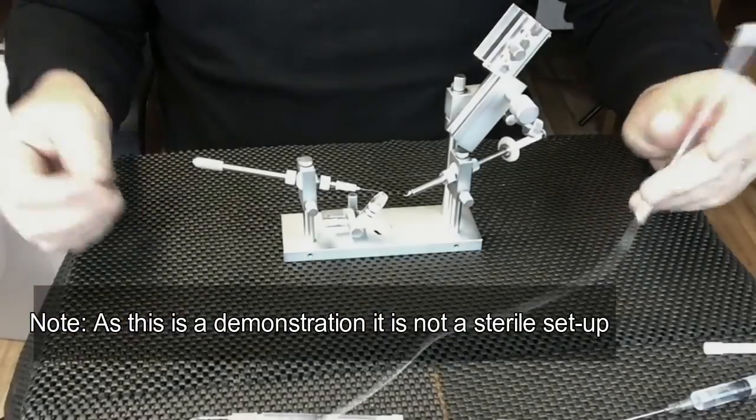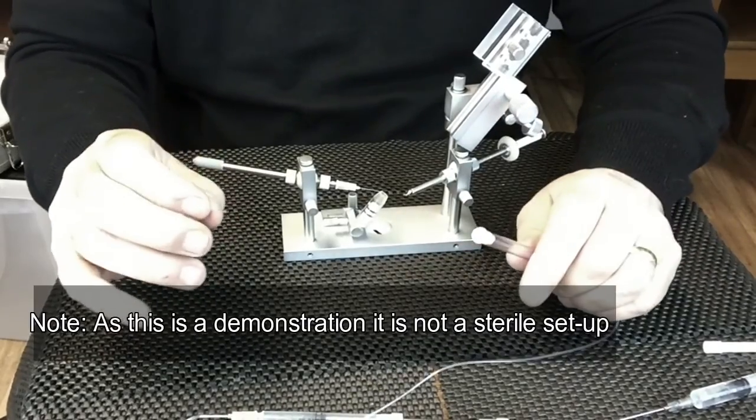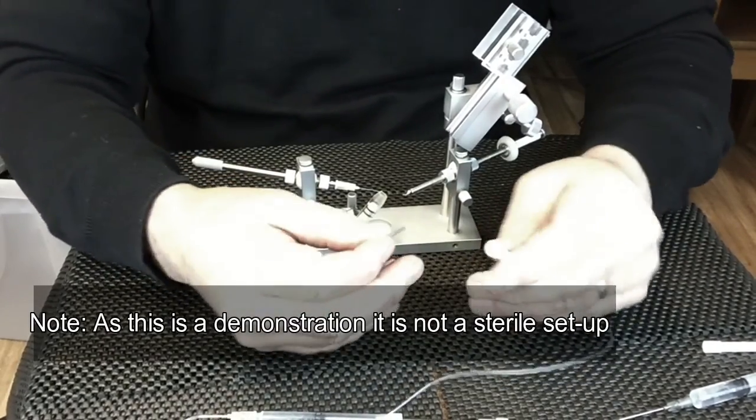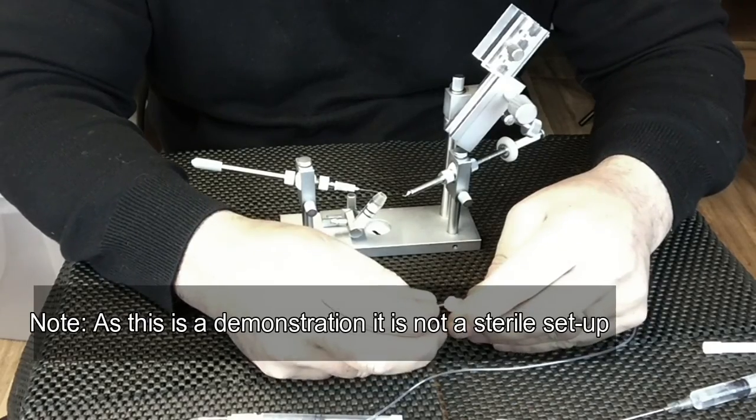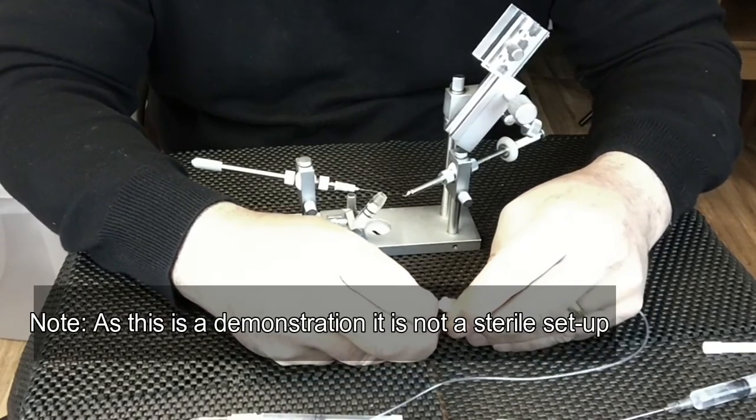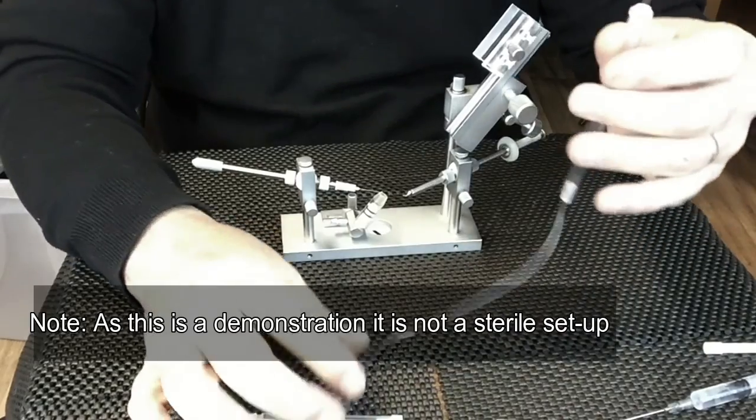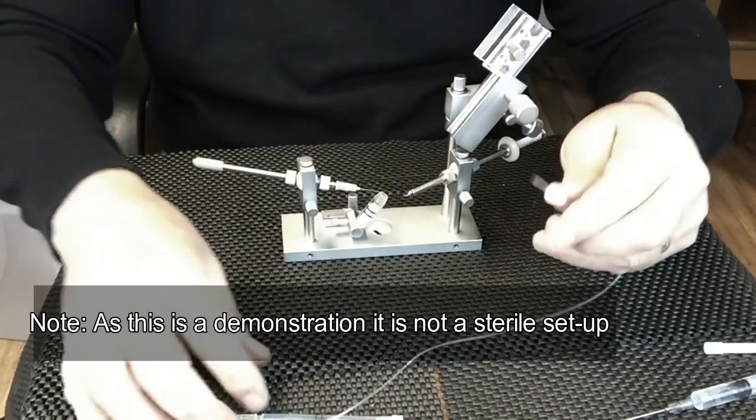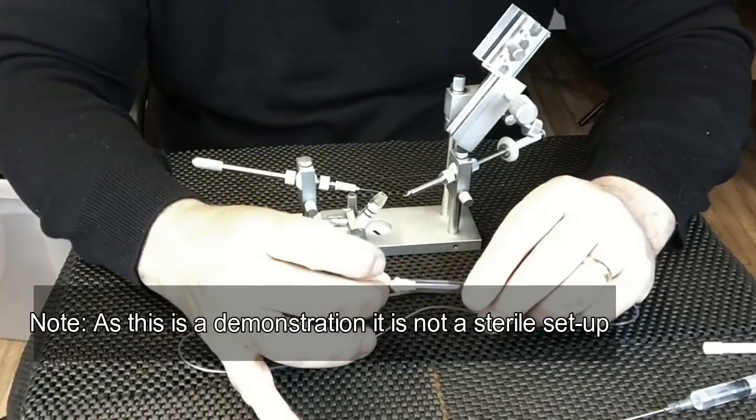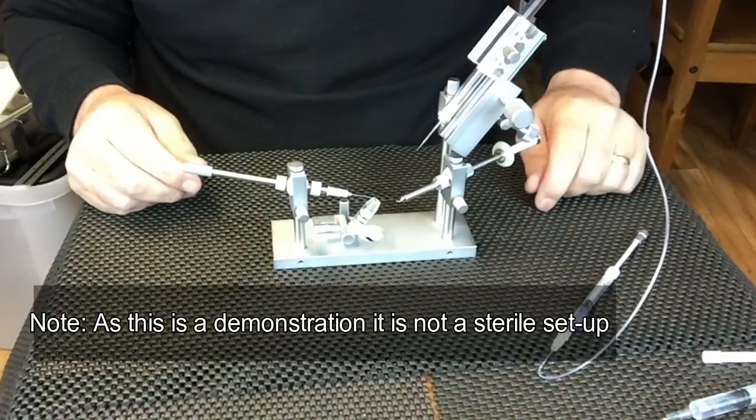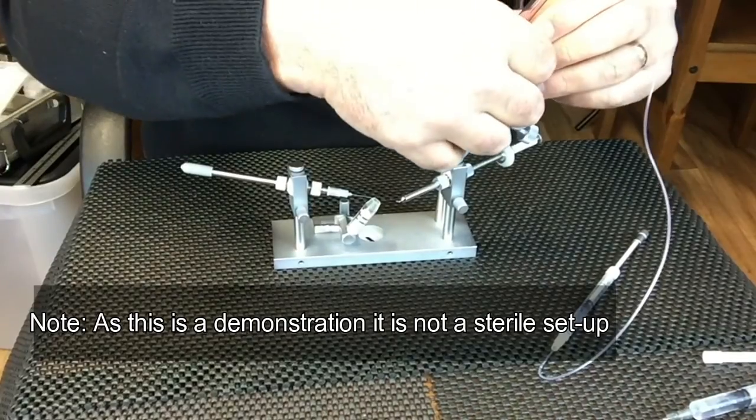You can connect one of your glass tips to the end, being careful not to break the end of the glass tip. Fit that into your syringe holder.